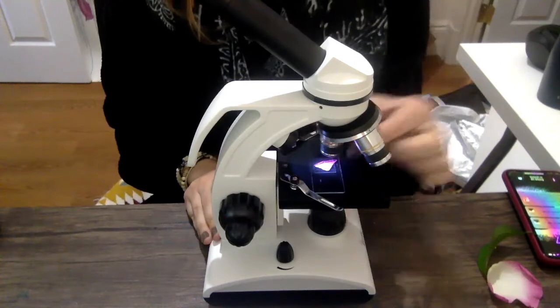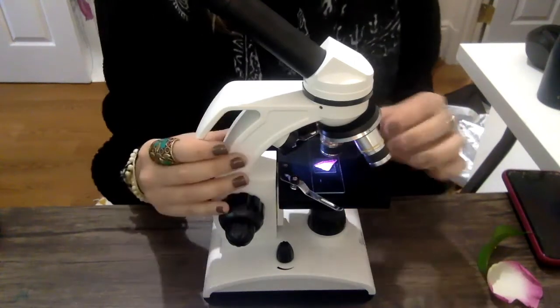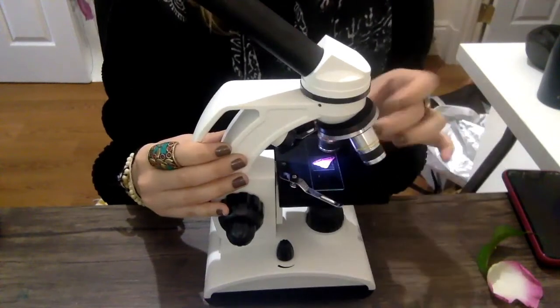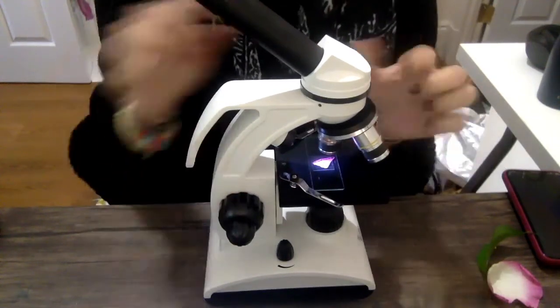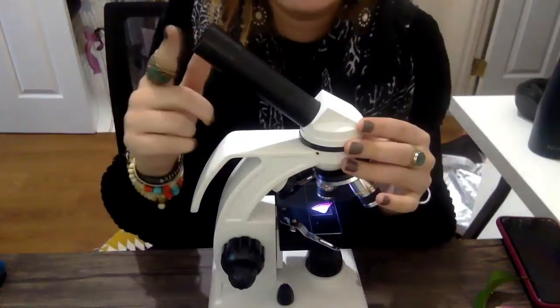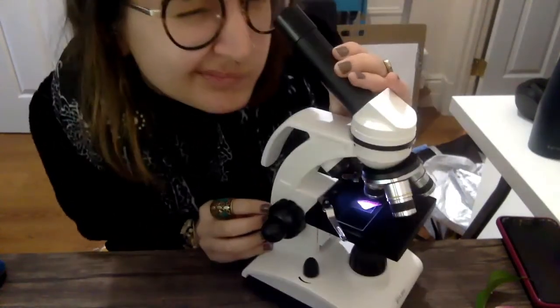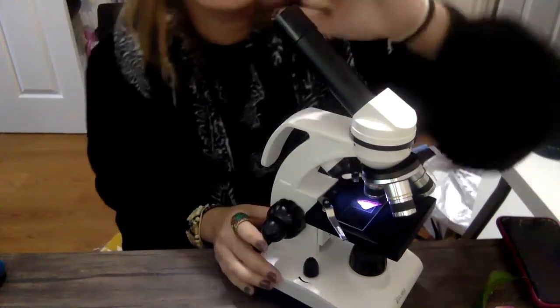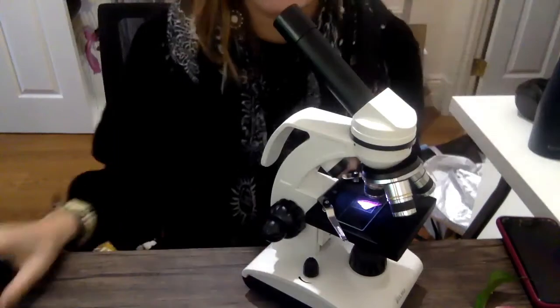And this right here, there's 3 of them. Do you see how this turns around? These are the lenses. So we're gonna look through the lens and then up through here. This is our viewfinder. So I'm gonna put my eyes up in here so I can see into it. And I'm gonna put my camera up to here so that you can see it.